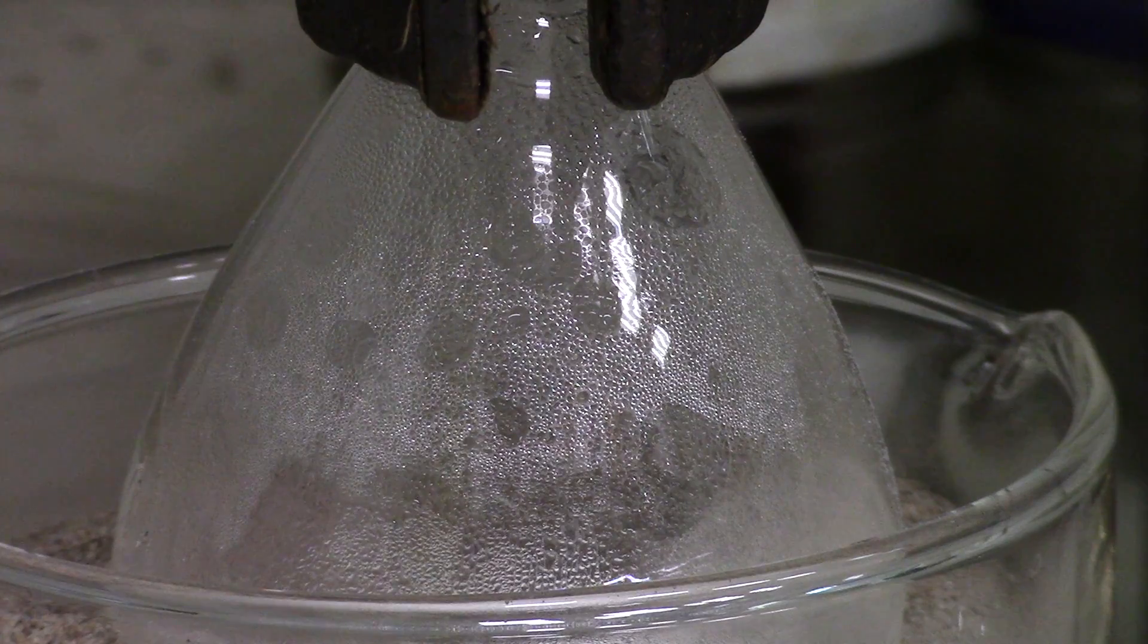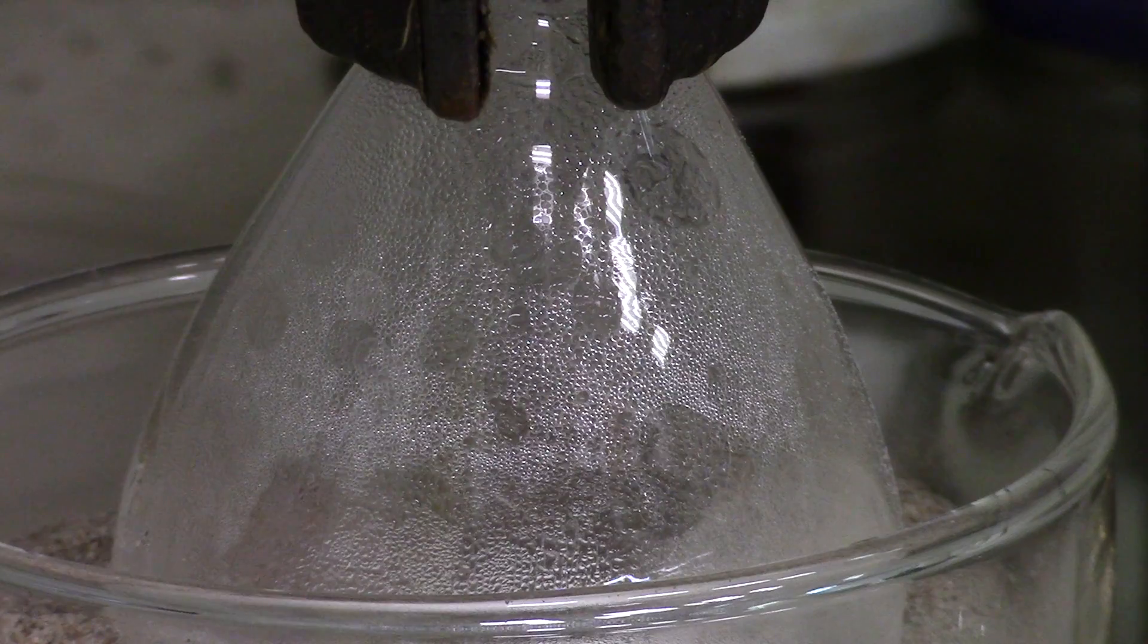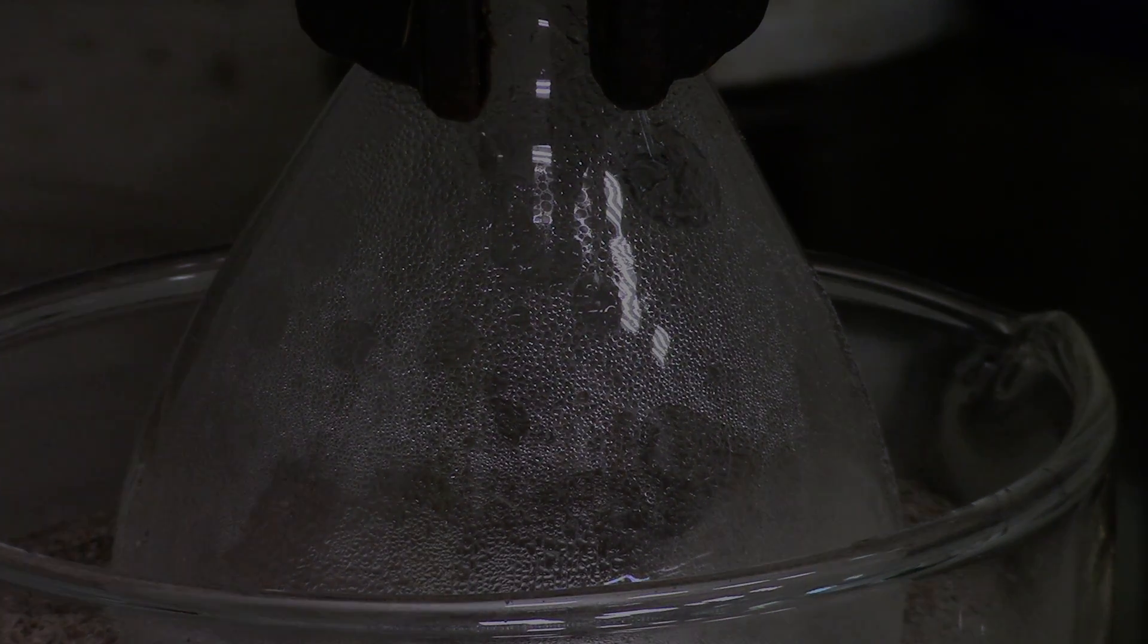Because of it, let me show you how to make hydrochloric acid by equilibrium reaction between boric acid and table salt. All of them could be easily obtained in drugstore and grocery.